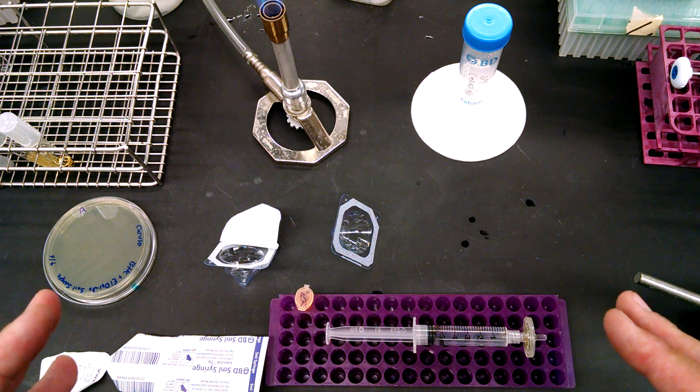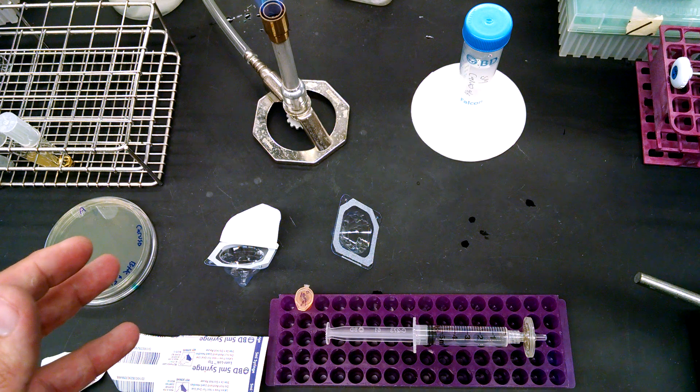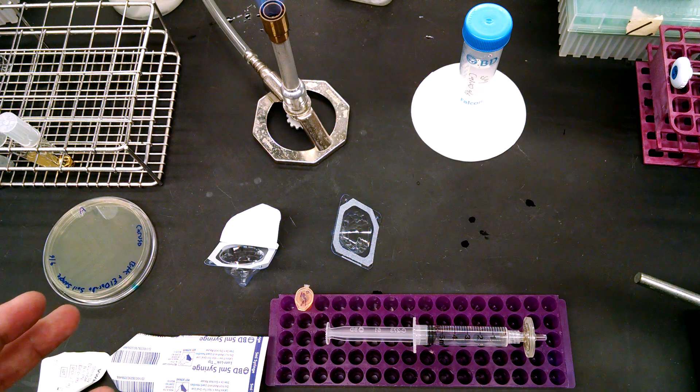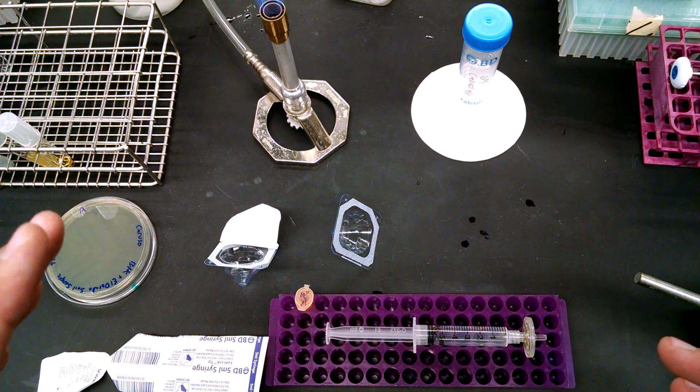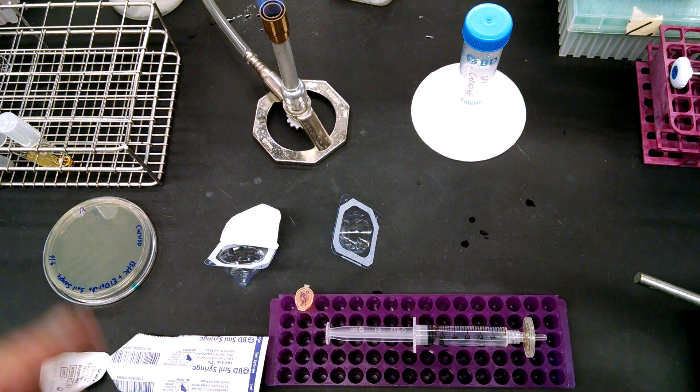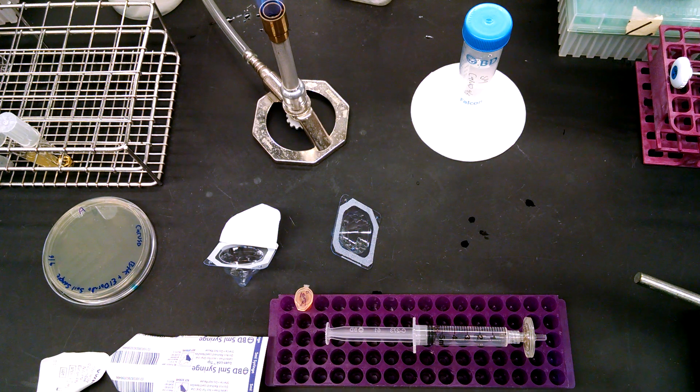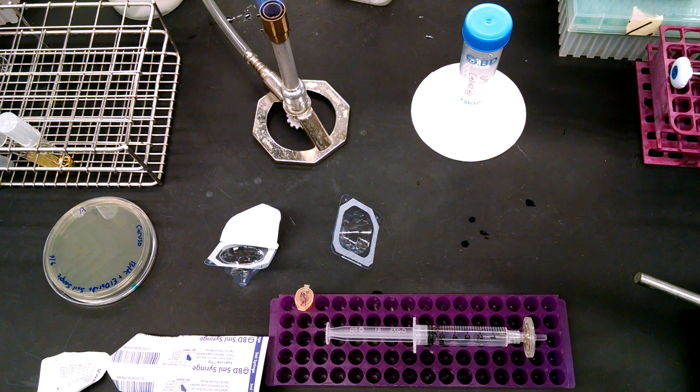Remember, that's what you're going to do to six of your samples. Before you do that, take one gram out of one of your samples, whichever one you want, and that's going to be used for your enrichment. And that's it. That's what you're doing. Have fun and find phages.